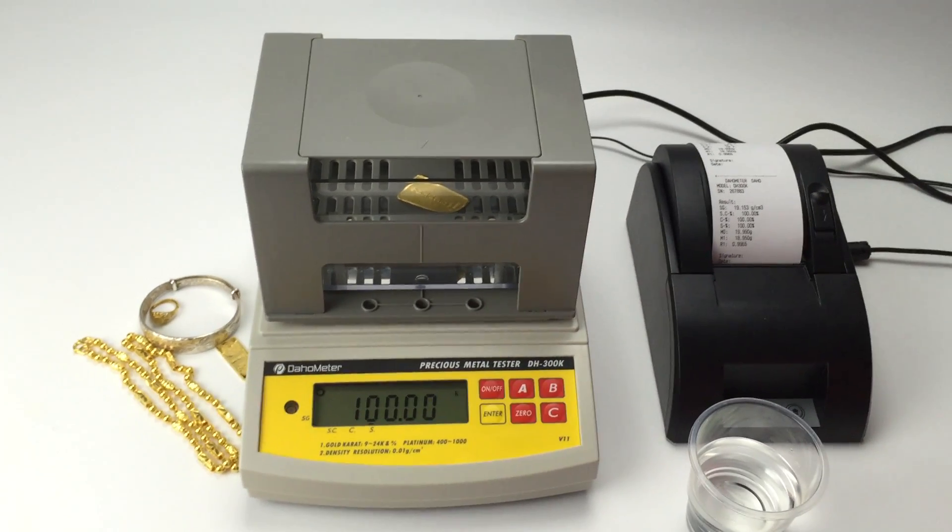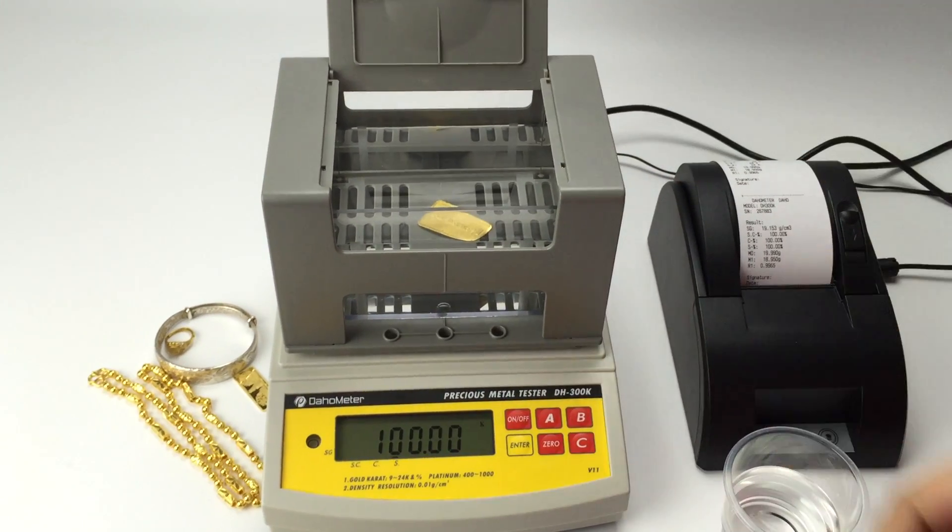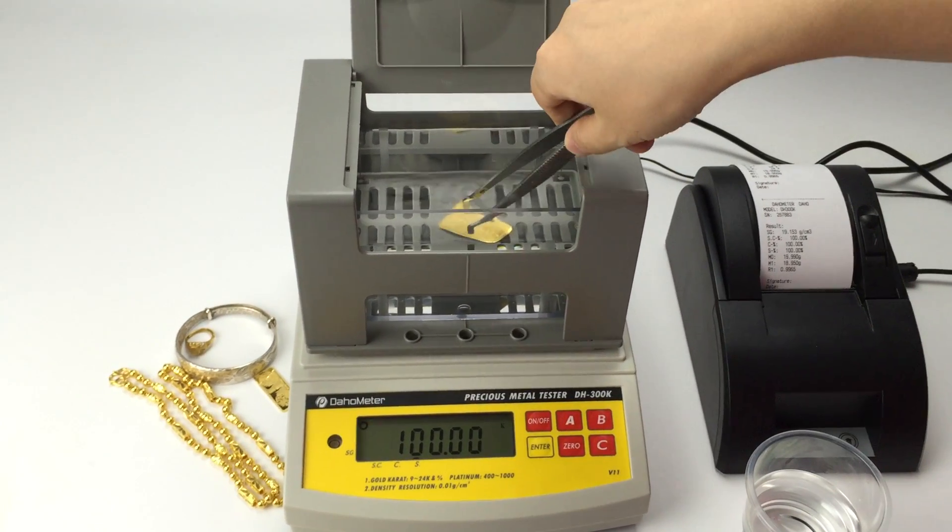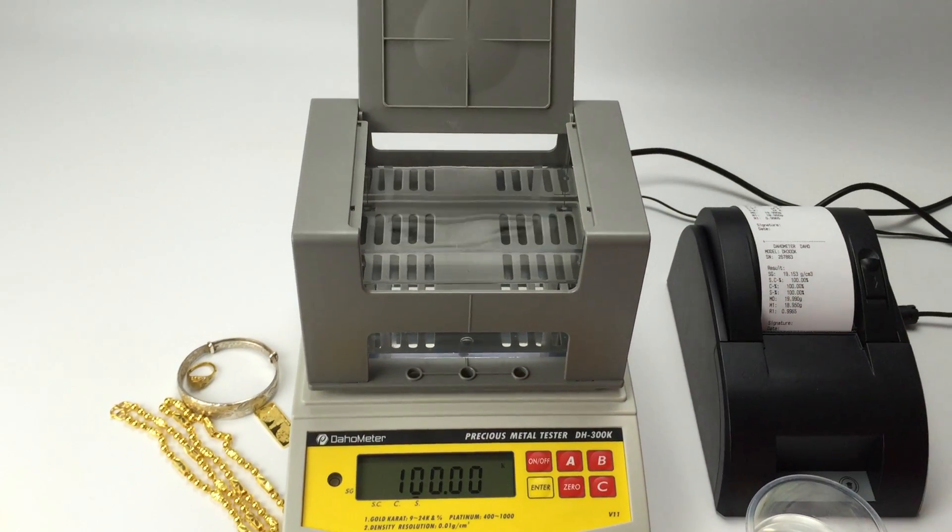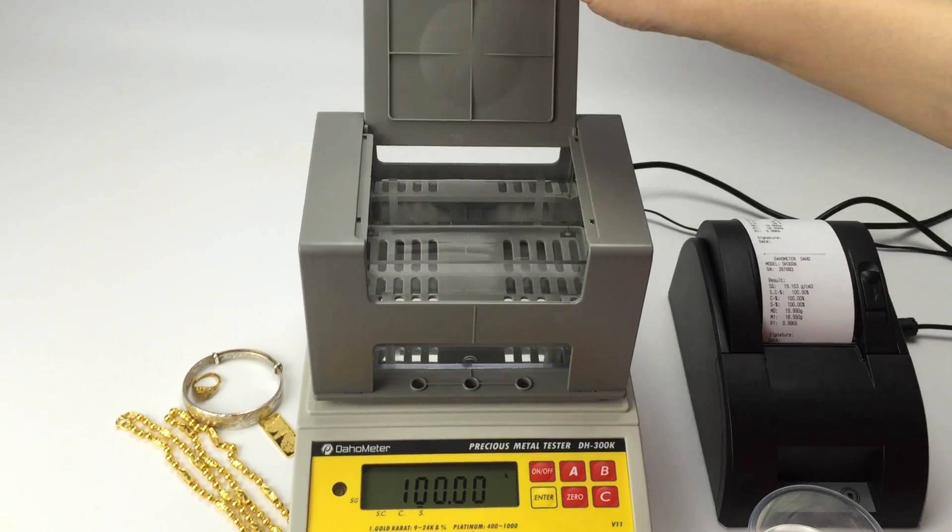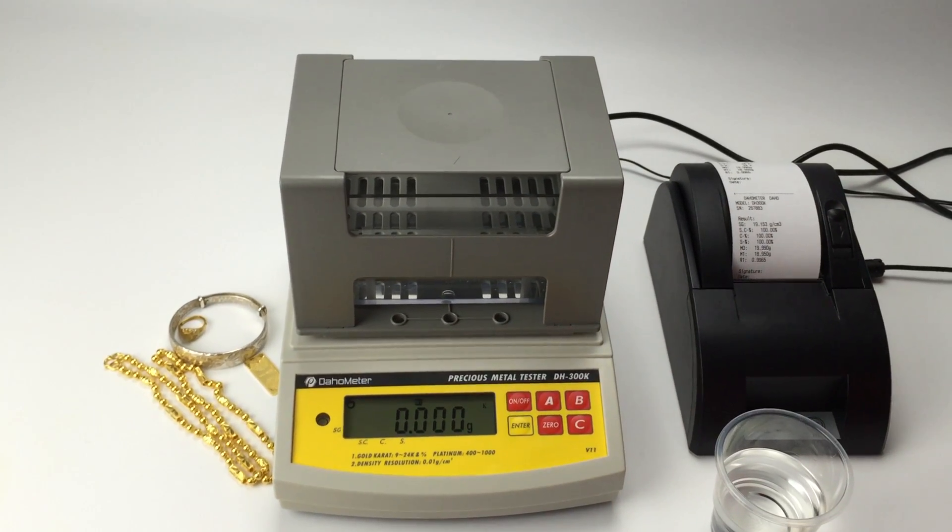Now let's take out the sample. The testing is done. Press ENTER. That's all.